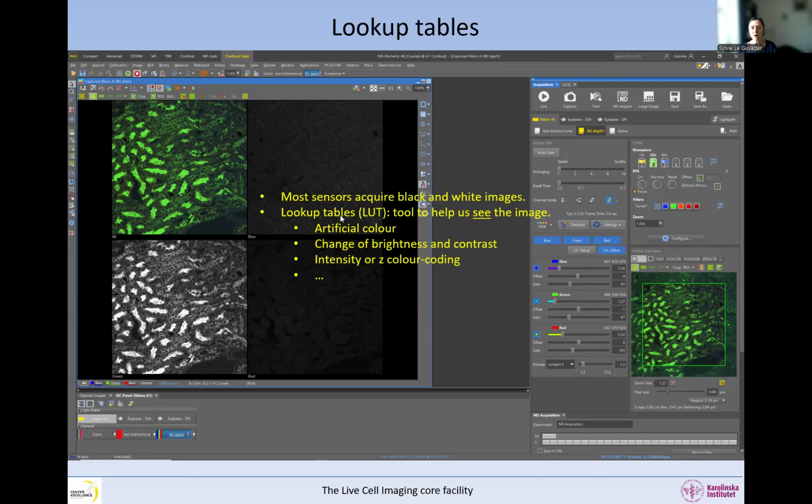So what are the different lookup tables that are available for us? For example, we can have artificial colors. So this one is color coded in green. The image is normally black and white, right? It can be changing the brightness and contrast. It's also a lookup table. The intensity in the Z color coding or time coding as well, where you apply a rainbow color depending on how bright it is, for example, or how deep it is in the sample, etc. All these things are lookup tables or LUTs.